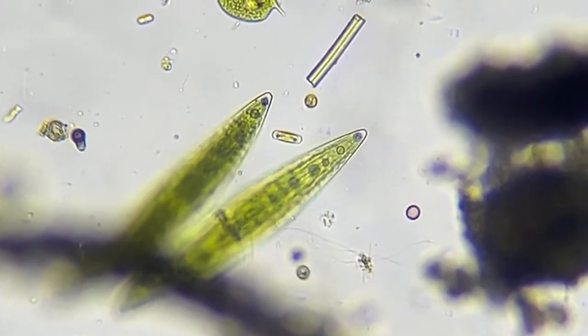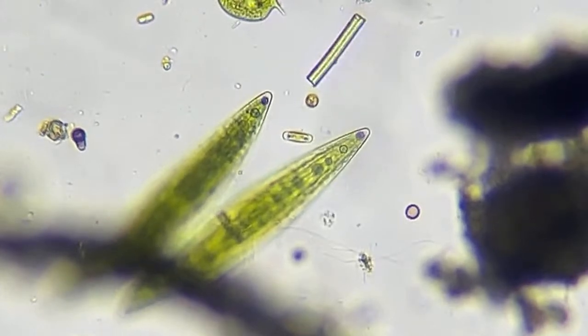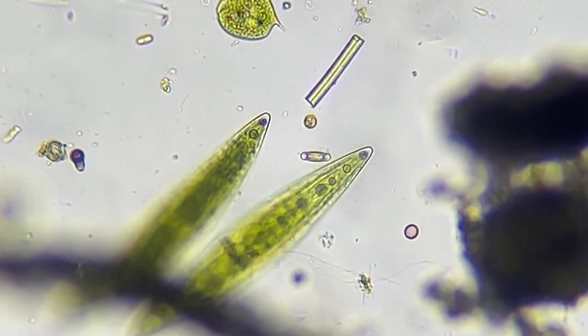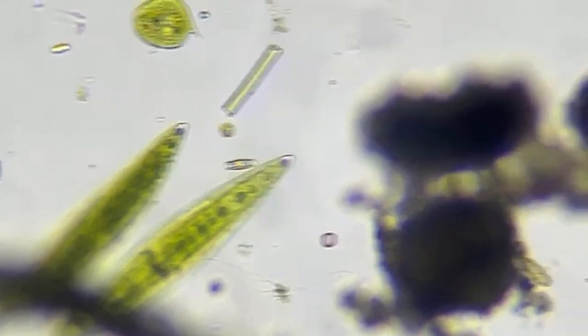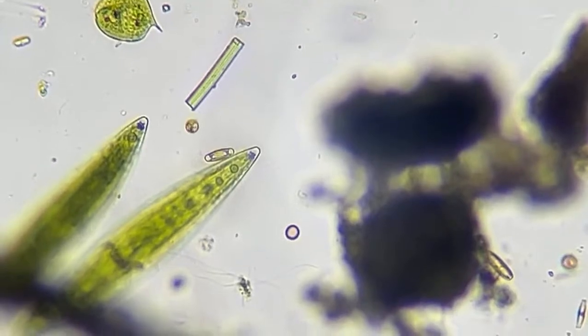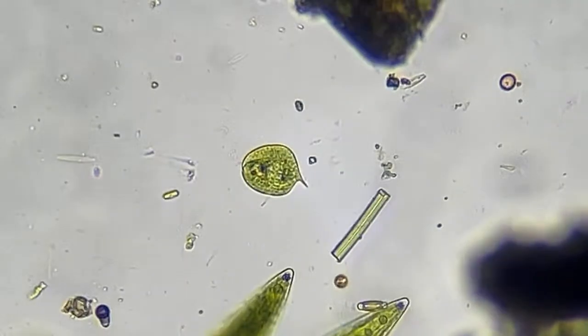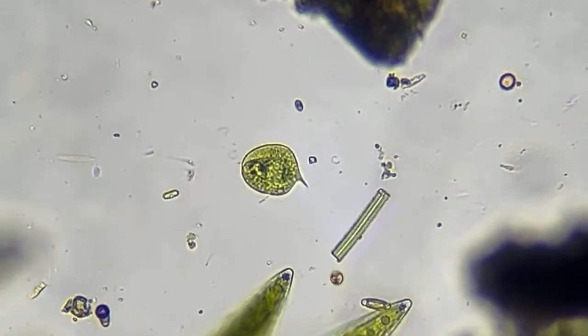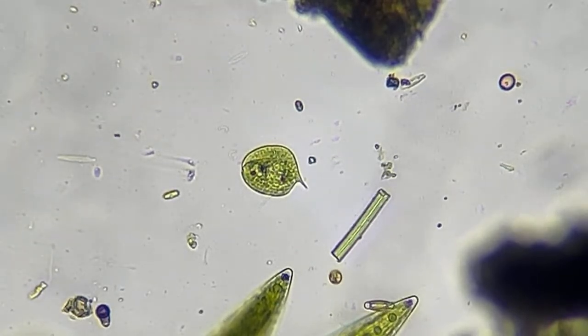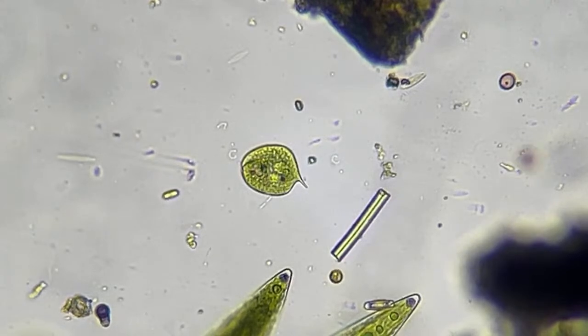See it moving around? And that's what's all over the oceans. And a lot of things eat those, whales and stuff. And they also make a lot of the oxygen. So that's pretty good to see. This is a Euglena. Usually these things are moving around like crazy, so it's good to see one stopped right there.